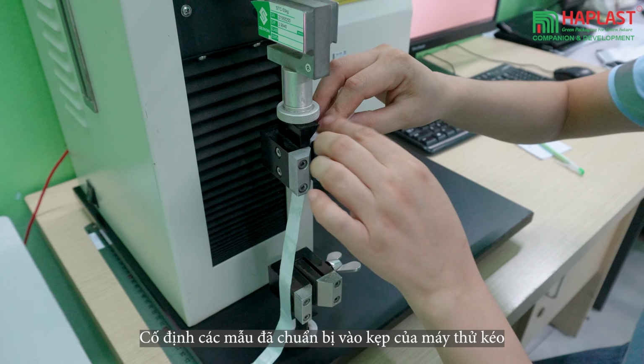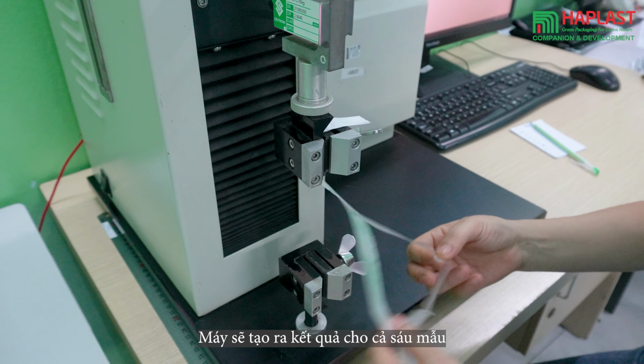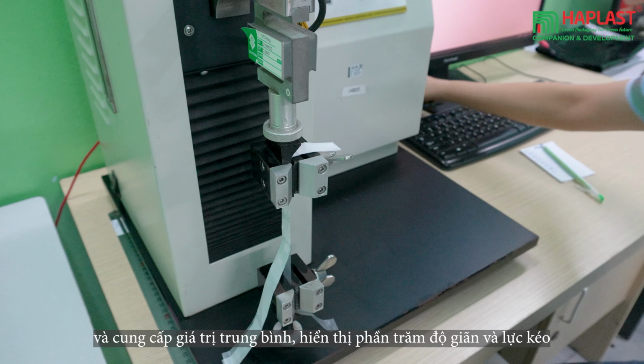Secure the prepared samples in the clamps of the tensile testing machine and test each sample one by one. The machine will generate results for all 6 samples and provide an average, detailing the stretch percentage and tensile force.